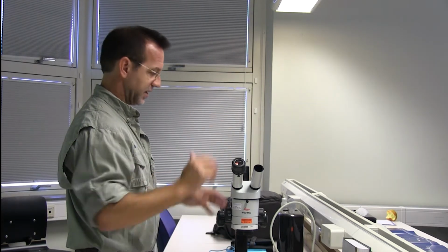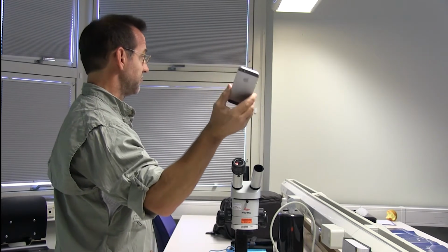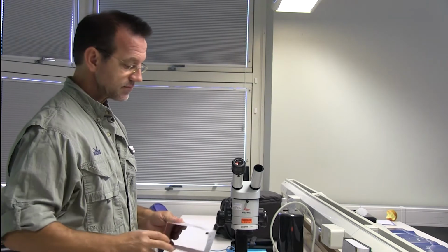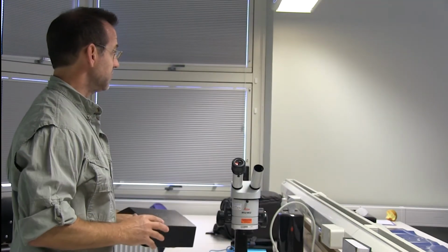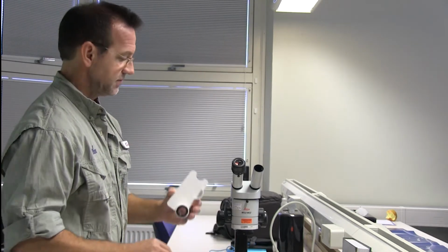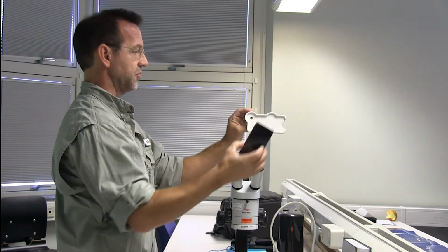Then you move on to more today's technology, where here is your camera, right? The advantage here is that most everybody has a phone, and most students have a phone. So one of the newer ones, and I can pass this around so you can see it. This company develops adapters for the iPhone. I don't think he's doing Android yet, but this is the adapter using the same principles as the one I just showed you. So here is the adapter for this specific size phone.